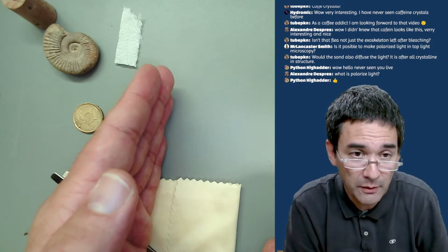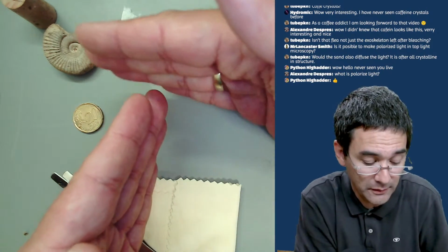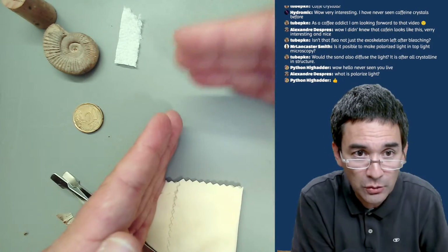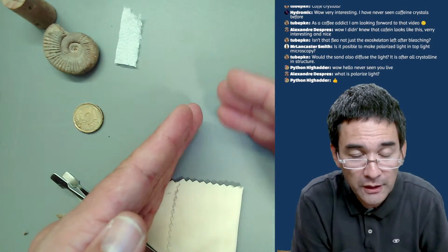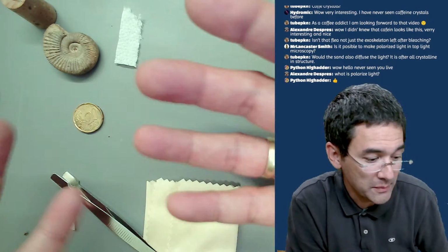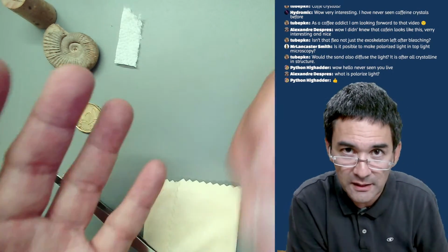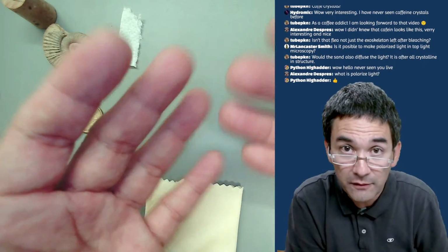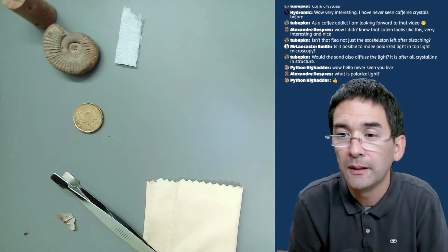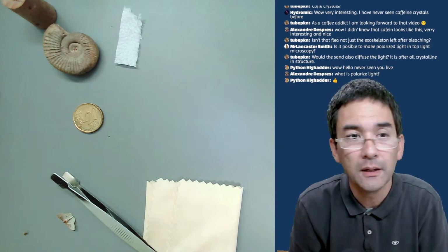There are certain polarization filters that only allow polarized light to go through, and when you rotate it, the light is not able to go through. Some substances are also able to polarize the light, and they interact with it. For example, crystals are a typical example here. They're interacting with this light.